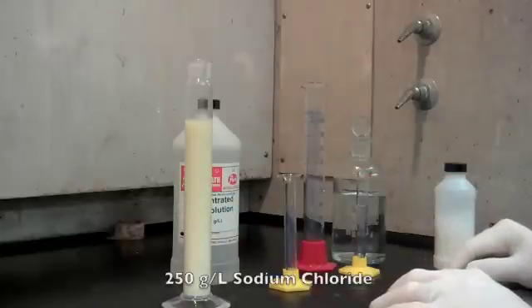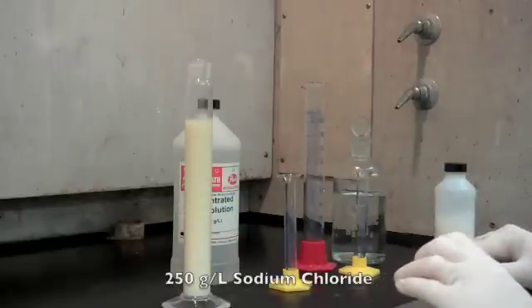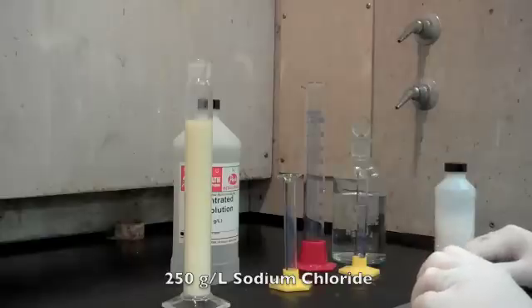The salt solution can be made by mixing 250 grams of sodium chloride or table salt into 1,000 mL of water.